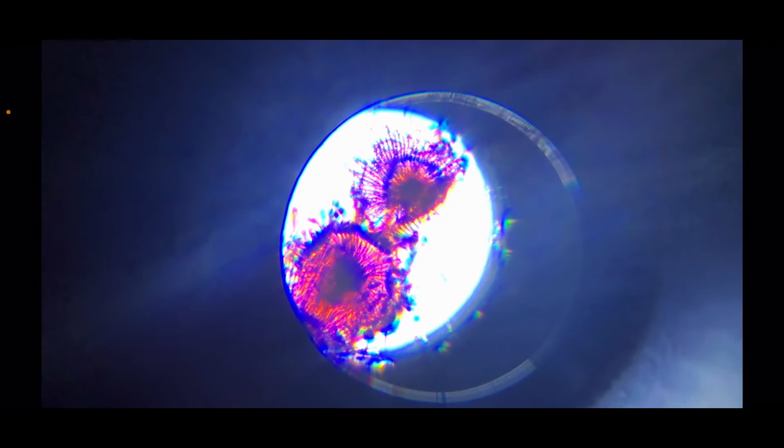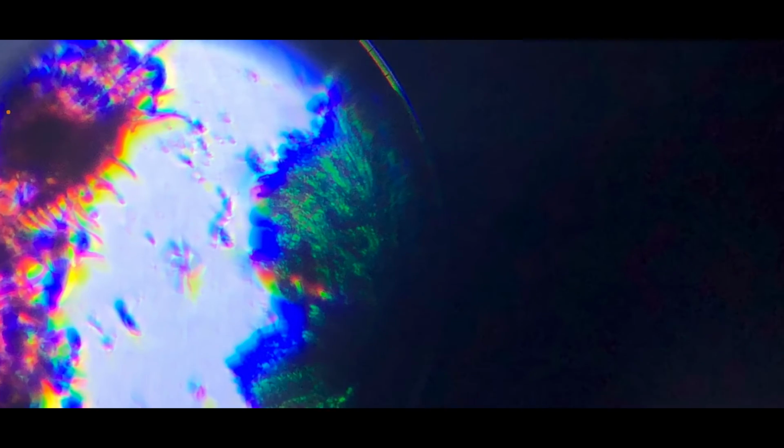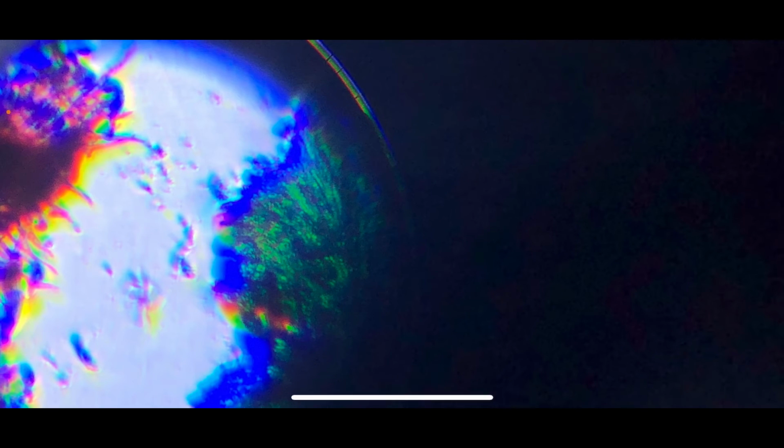Sometimes it's a really cool image, like you can see the little fibers in there and also the outside shapes. So they do look somewhat like shells, except they're so much more beautiful than shells. I actually have a green one, and in this part of the green, you might be able to see that the same fiber is right over there, the same basic shape.